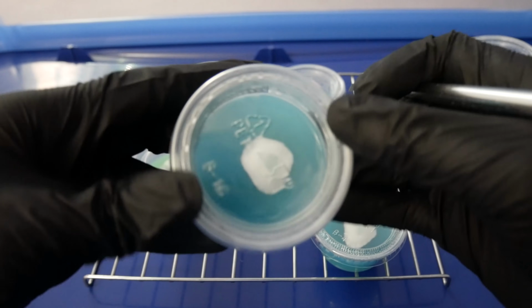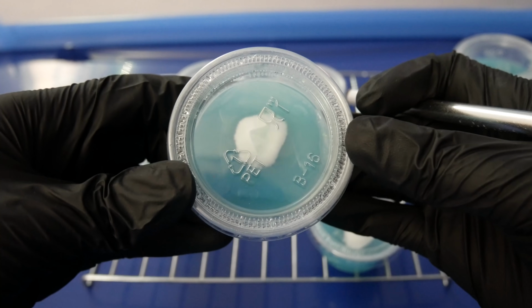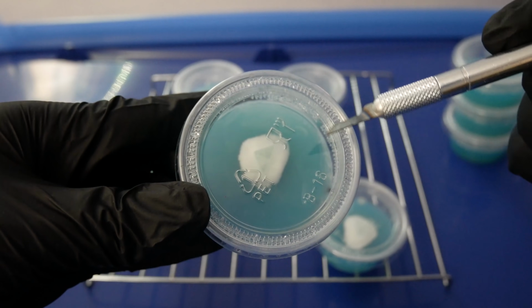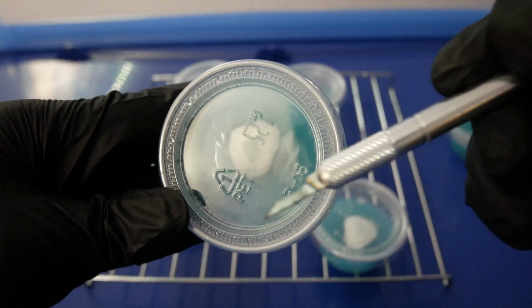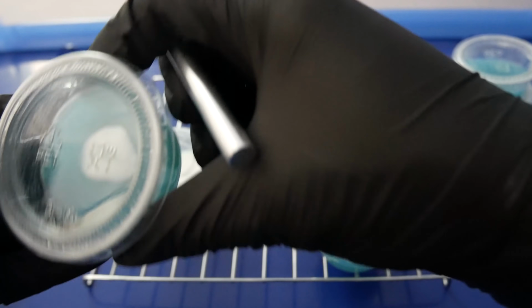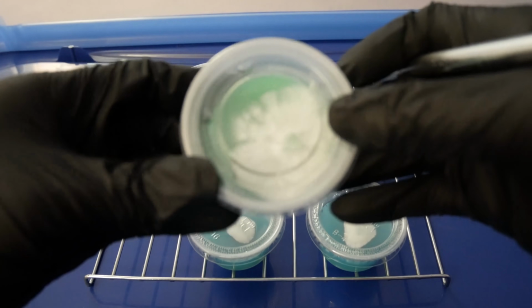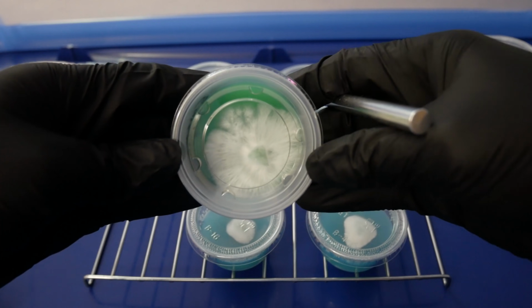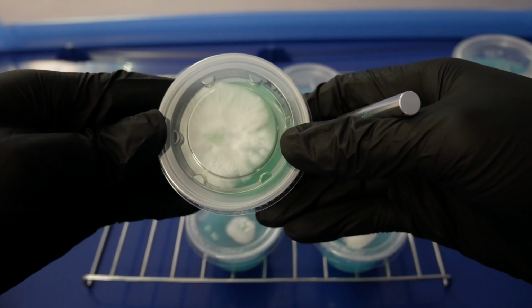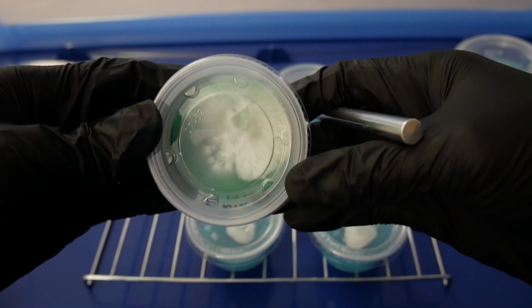Here's another plate that's got some bacterial growth on it. You can see here there's some sliminess going on inside of this cup, specifically more towards the top portion, kind of circling around it, moving it around. You can kind of see where the slimes are, so I will show you guys how we're going to clean this up. And the last plate here, we've got some pretty clean growth on this one. I don't see any signs of contamination on this one, but we'll go ahead and do a transfer off of it anyway, just to ensure that we have clean growth moving on to a new dish.